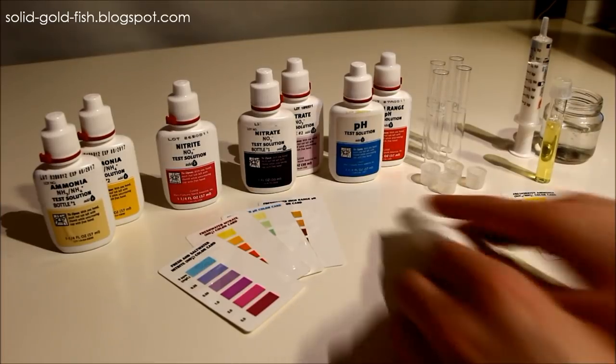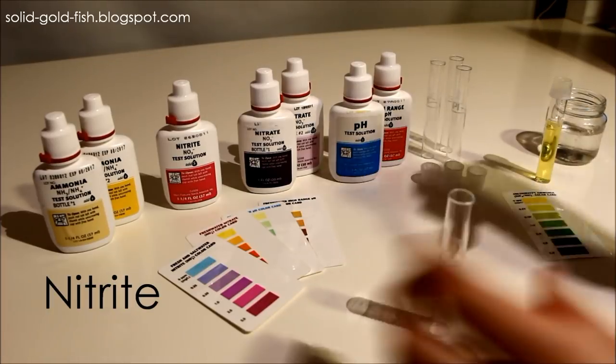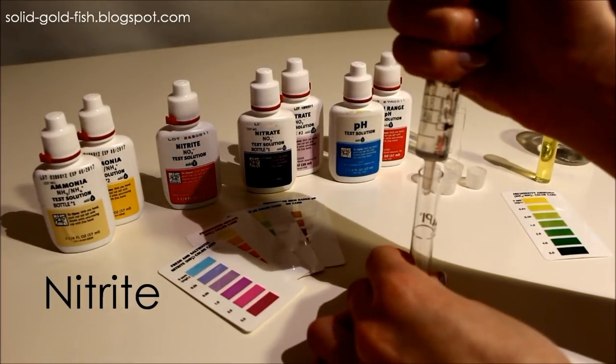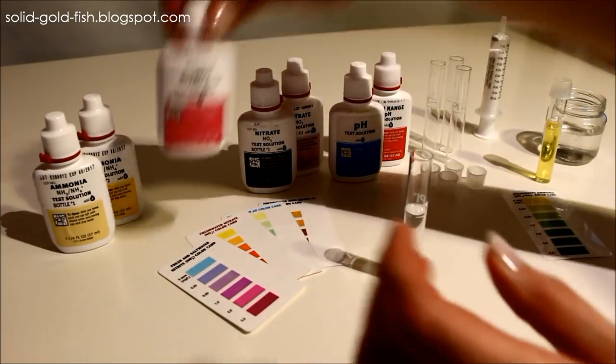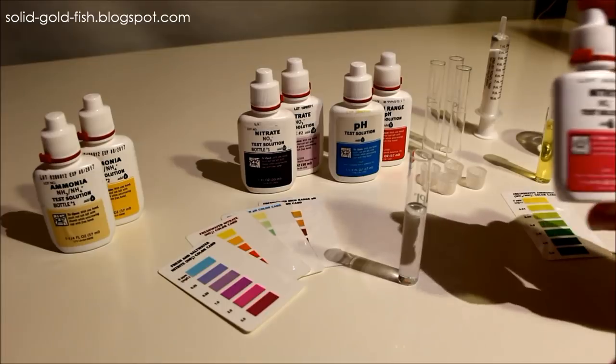Then I do the nitrite test. Start the same way, just add water to the five milliliter mark. This one's pretty easy, you just add five drops and it only has one solution bottle. Then again you shake it for five seconds.